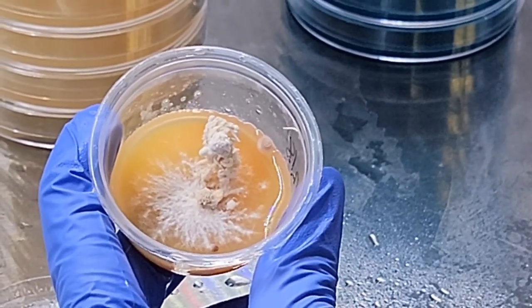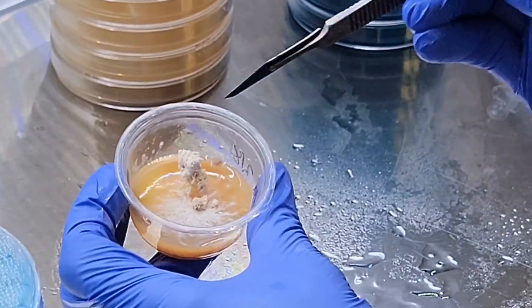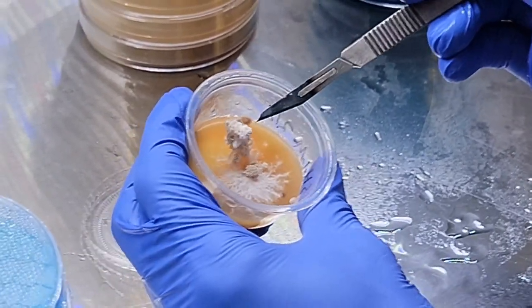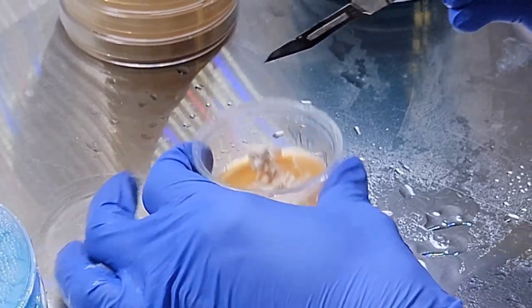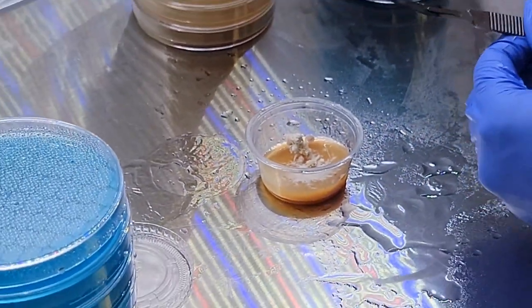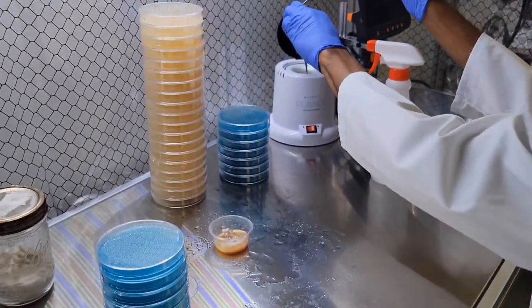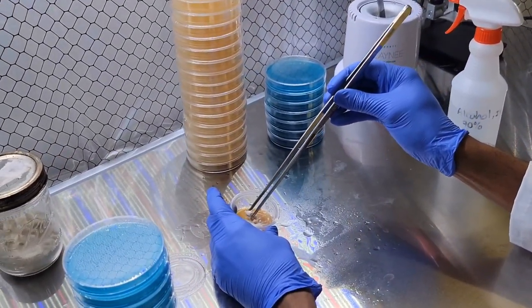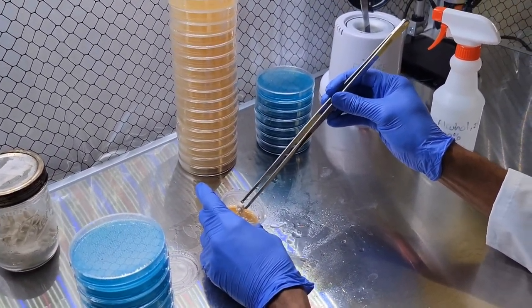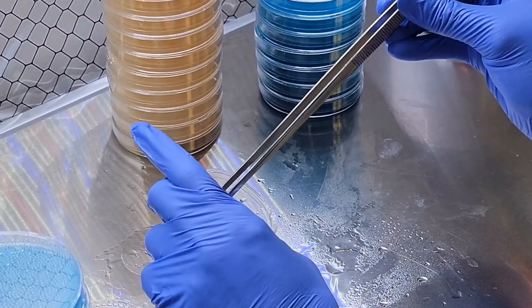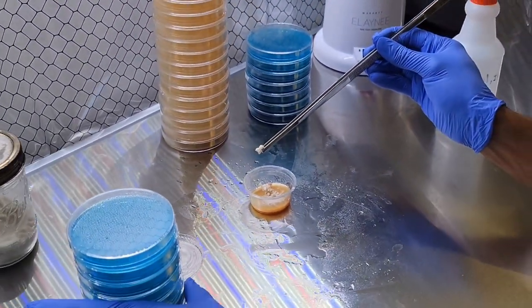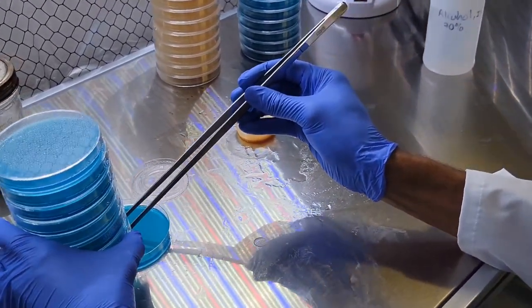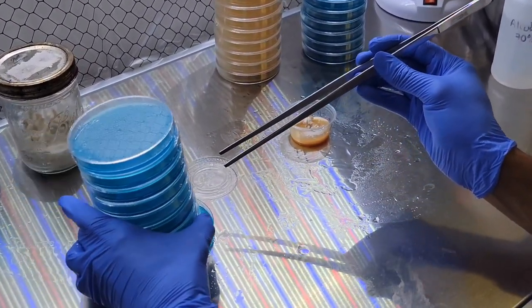But everything else here is new. So if you wanted, you could take this fresh growth because you know this is probably sterile as long as the bacteria hasn't grown up to it. And this one actually would be a better case. There we go. We'll start with this one. We'll see which one grows better. There we go. That's all it takes.